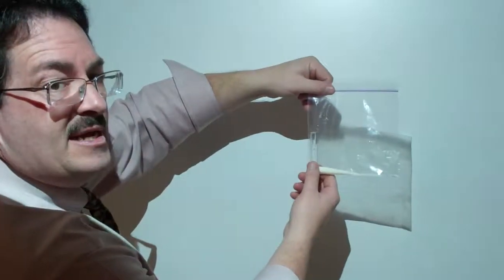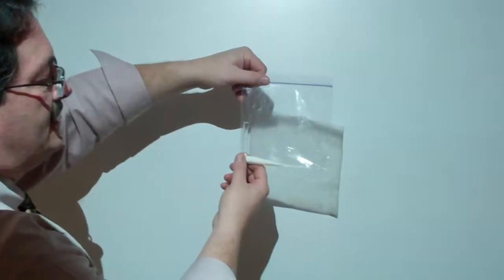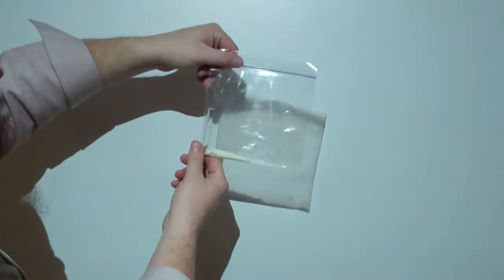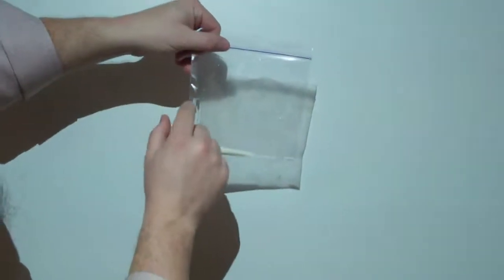Okay, this is a reaction of sodium nitrite and hydrochloric acid. We're going to spill the hydrochloric acid into the sodium nitrite.